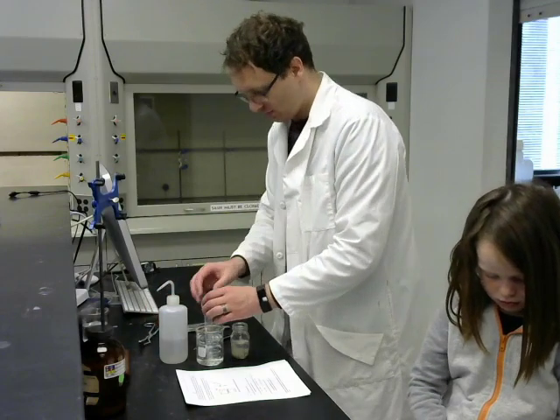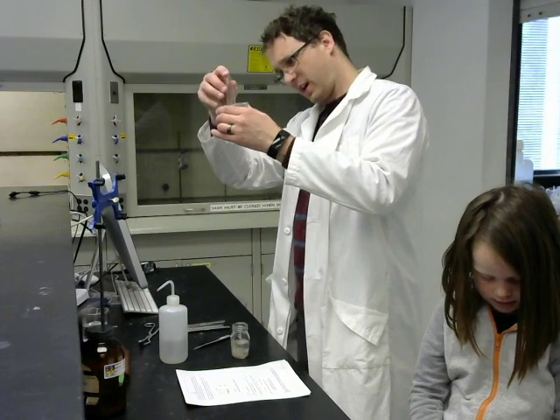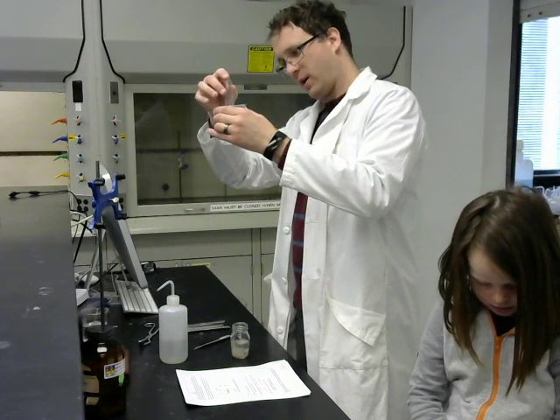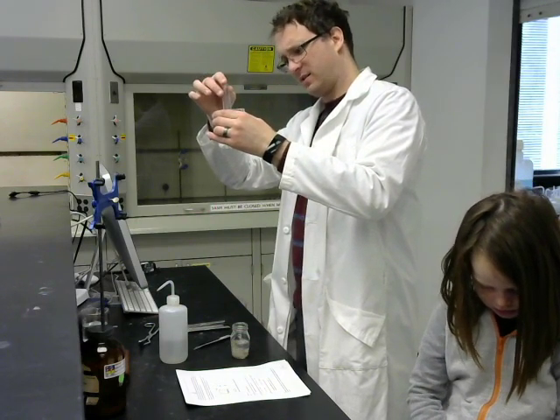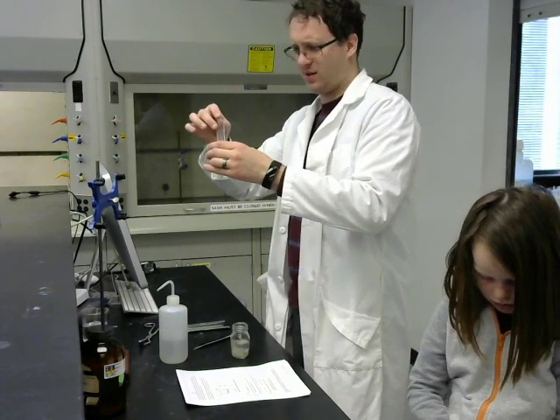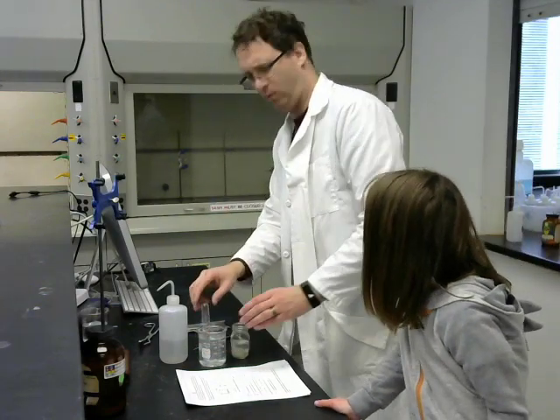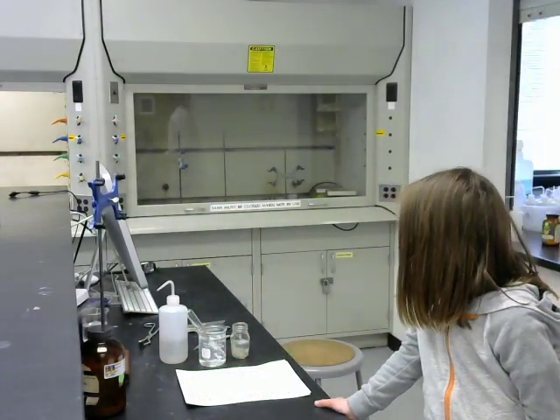And you saw it was immediately reacting. It was forming bubbles, and now this test tube is filled with gas. And that's it, the sodium is gone. It actually escaped, and now it's bubbling on the surface. Oh, gosh, it actually kind of smells.